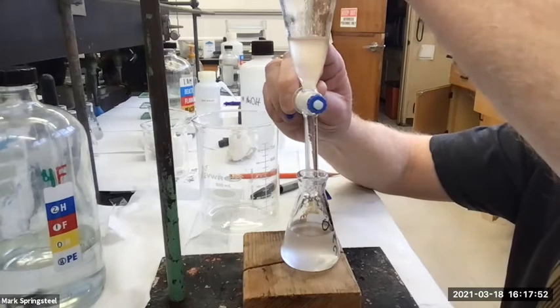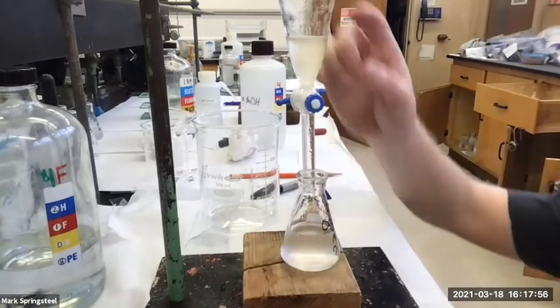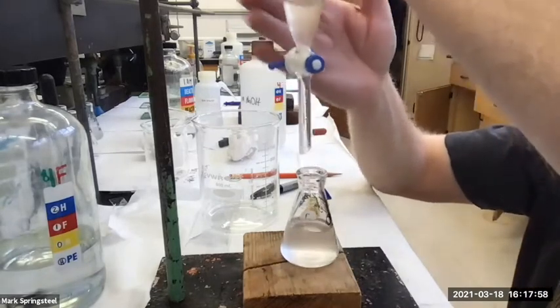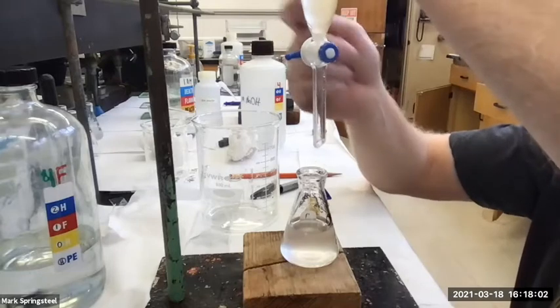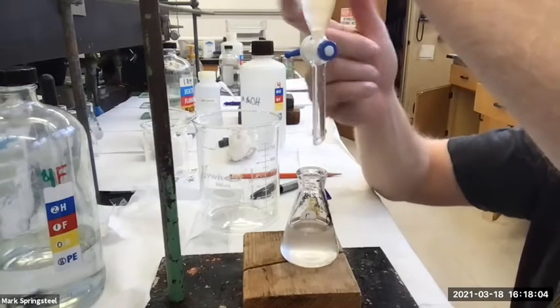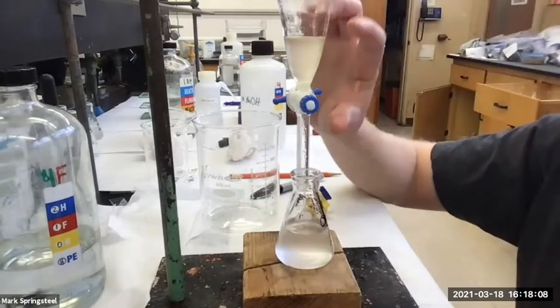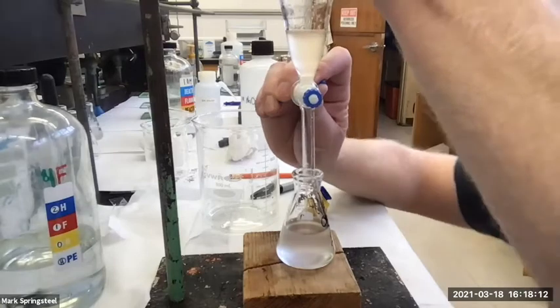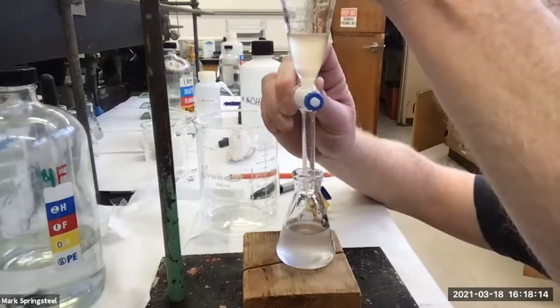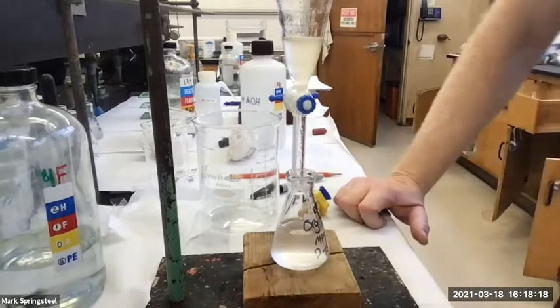And this time, I'm actually going to err on the side of putting a little aqueous in here, because if I have organic in this aqueous layer, then there's a problem: when I try to make a precipitate, instead of seeing that precipitate, it dissolves in a little bit of organic that's there. So I'm going to drain a little more, make sure I get all that out. Okay, I feel good about that now.